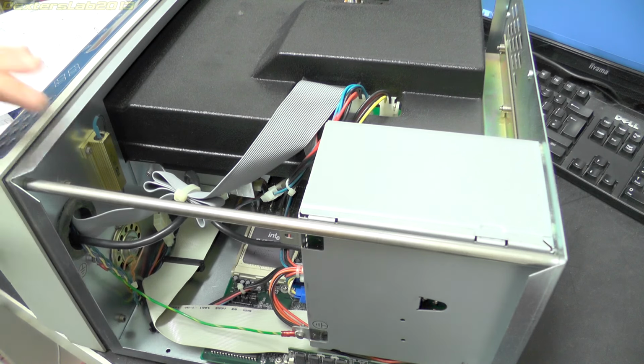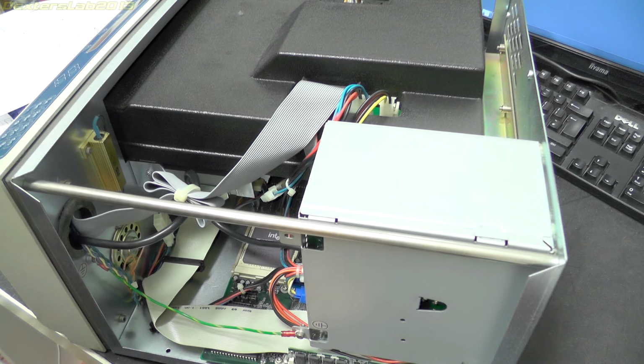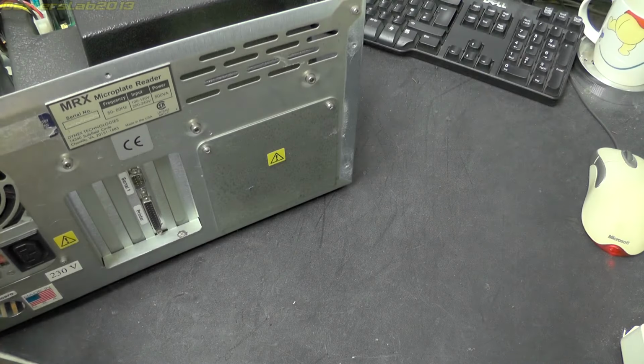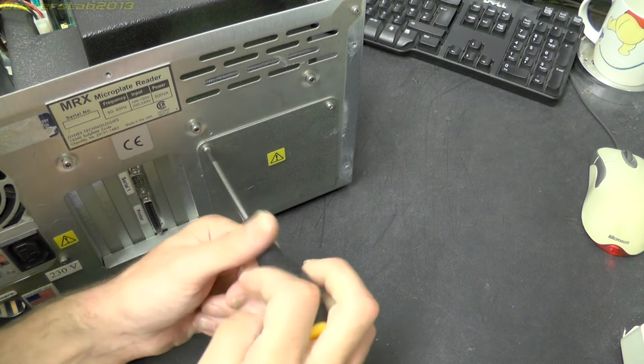So let's just start taking this apart a little bit more, and if anybody remembers the old PC cases, I'll probably get cut to ribbons very shortly, so excuse me if there's any blood. Right, before I start taking it apart properly, let's take off this rear cover.